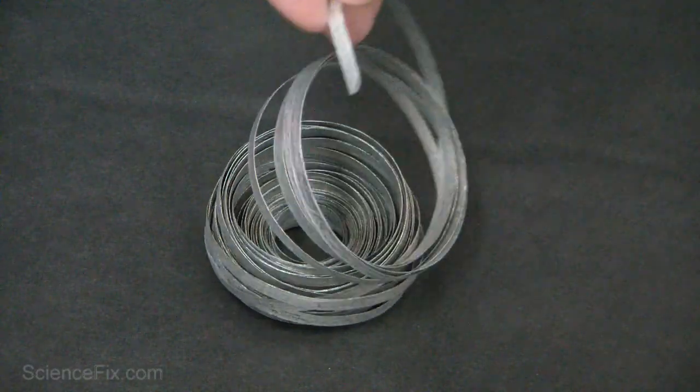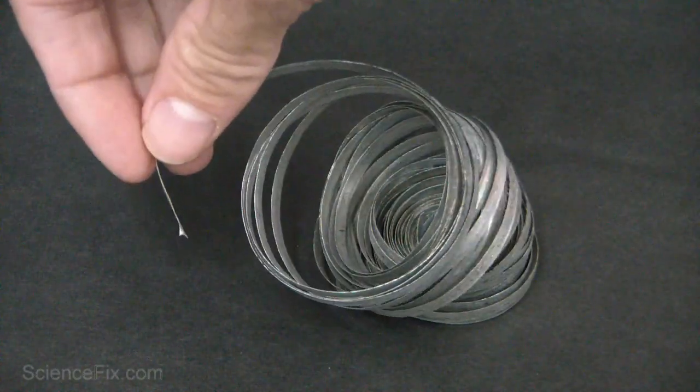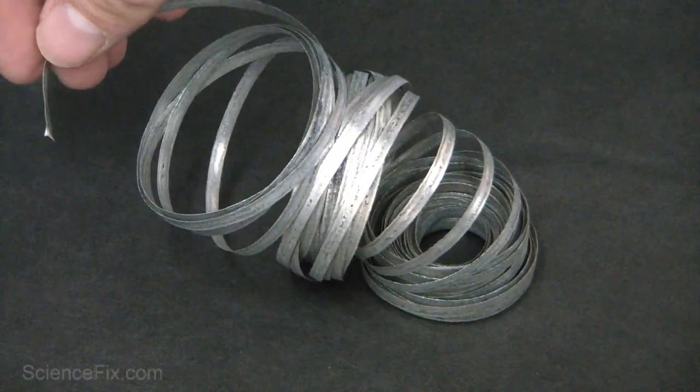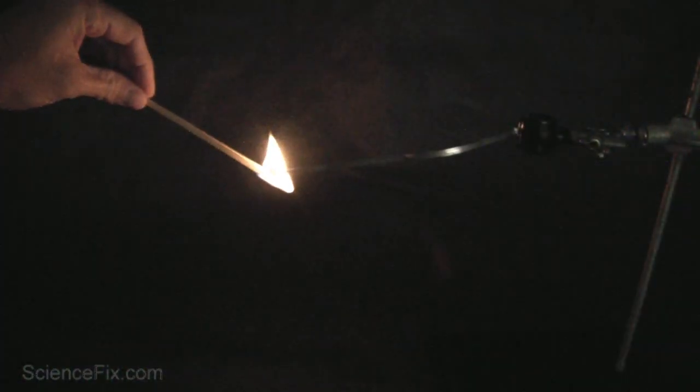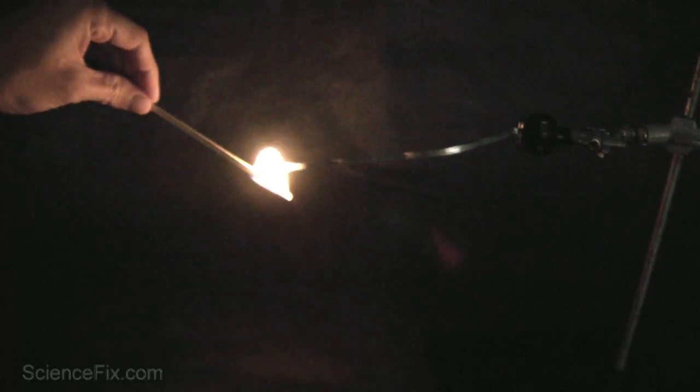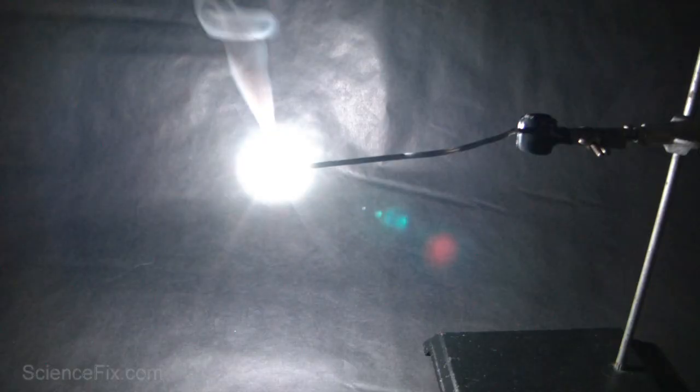So what we're going to do is react this magnesium with the oxygen in the air. We need a little activation energy to get the magnesium to react with the oxygen. And there it is.